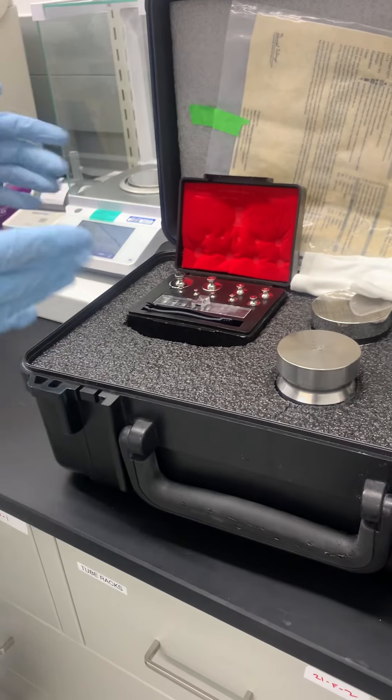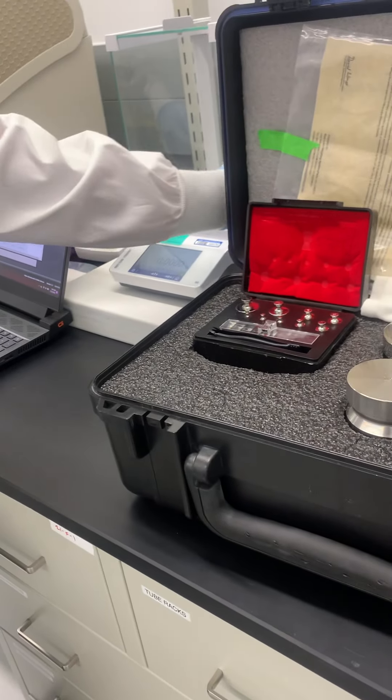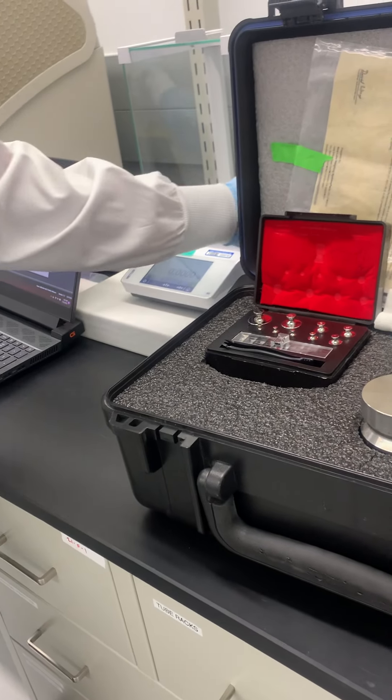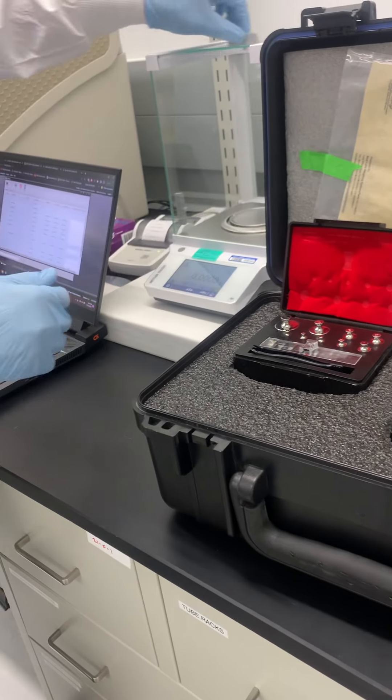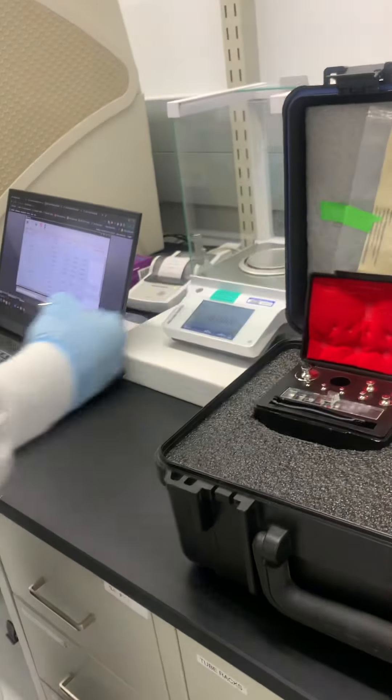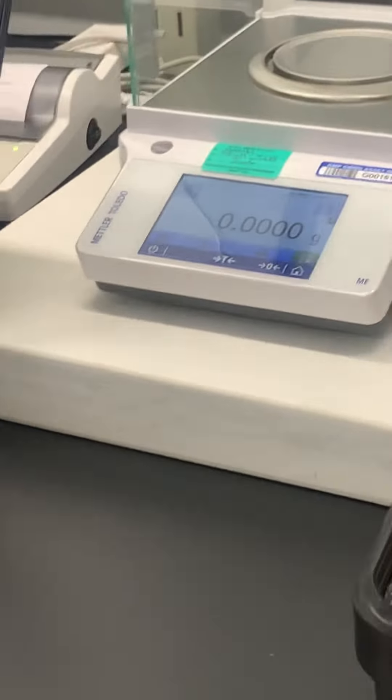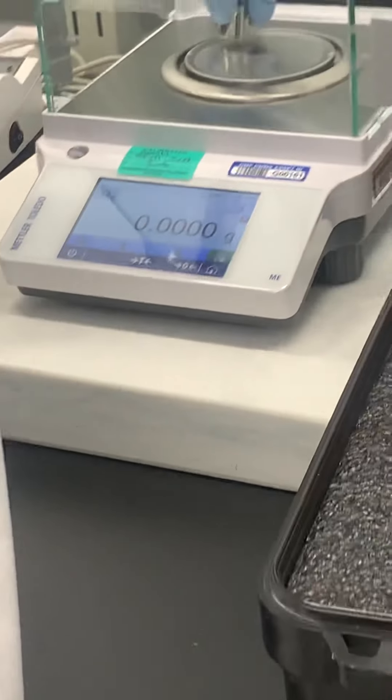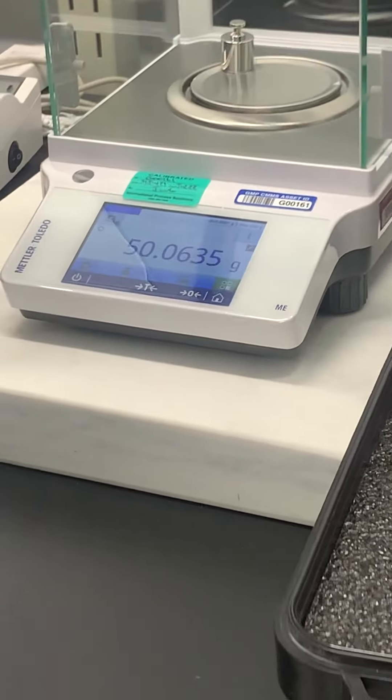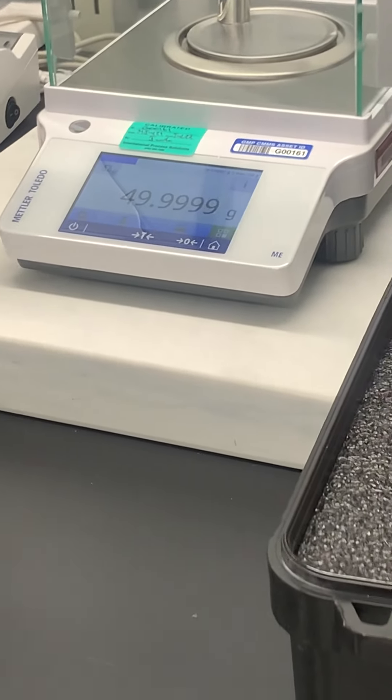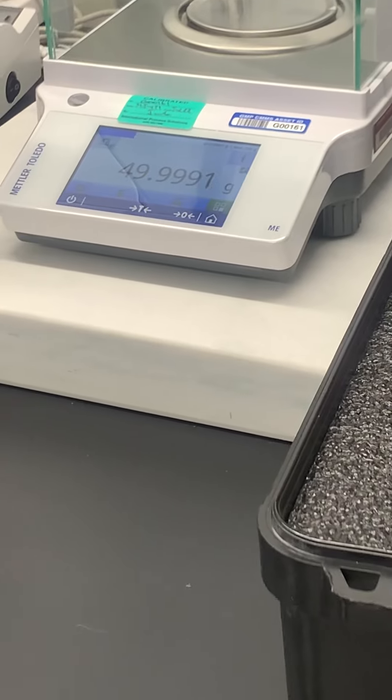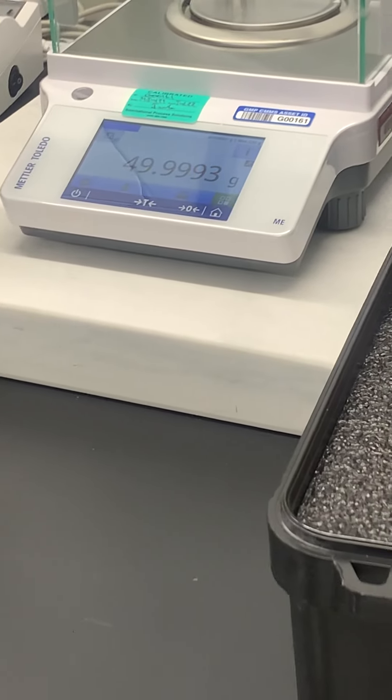Got you. Just corner tests, so upper left, upper right, center. And for these guys they're really sensitive. That's why I have these glass-like containers - if even a little bit of air pressure is going to mess it up.